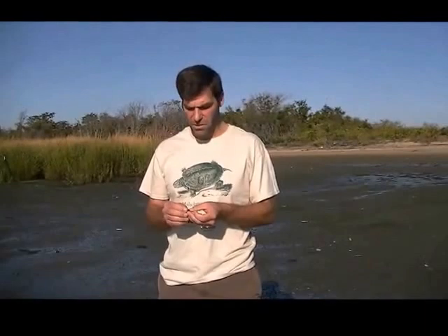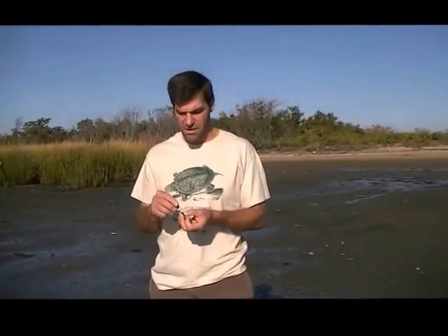I'm going to tell you about how we're going to collect for the parasites that are on the mud snails. And so what we're going to do is look at the mud snails at about every meter along a mud flat like you see here. So if you're in an area where there's many mud snails like we have here at Jamaica Bay, you'll be able to get about 100 mud snails, which is what you need to verify whether the parasite is here or not.